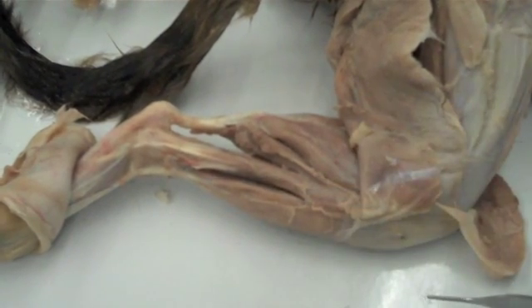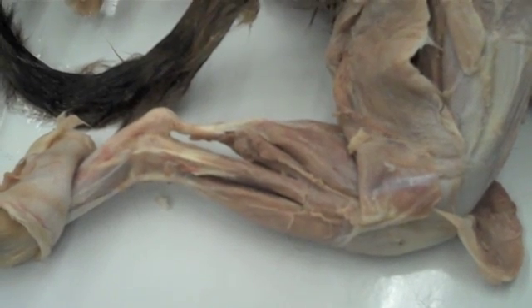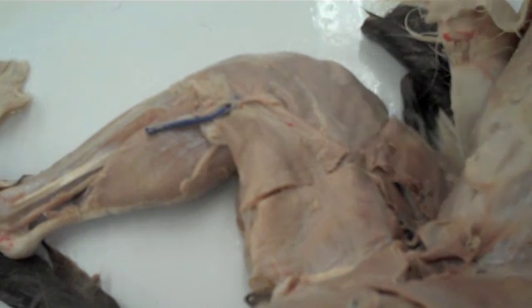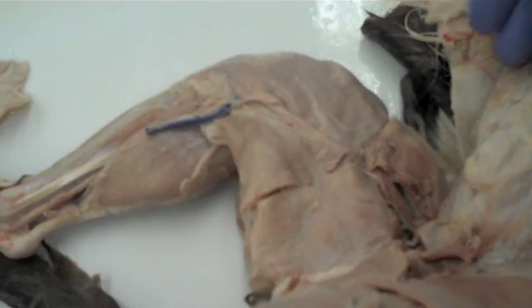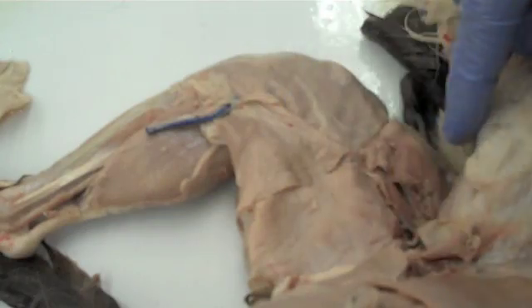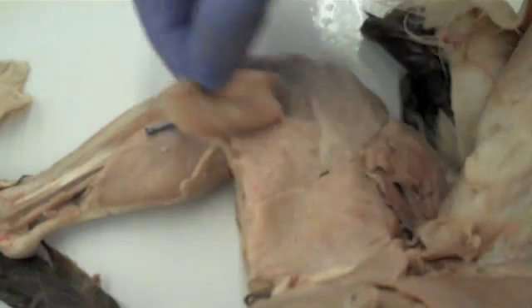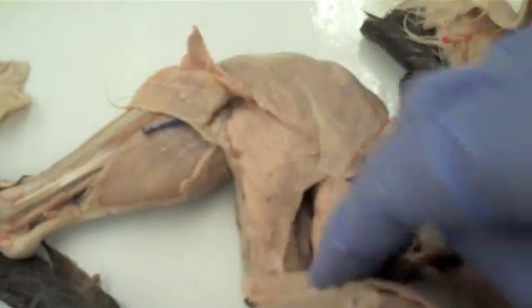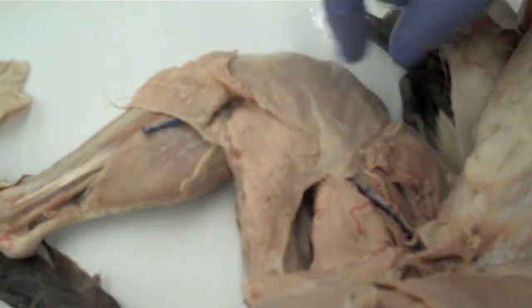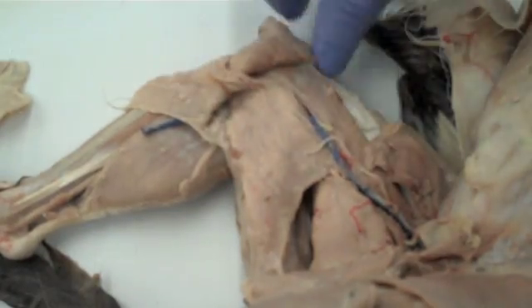In a moment I'll flip this over and you can take a look at the medial muscles of the cat thigh. On the medial right thigh, on the surface there are really only two muscles visible. One is the posterior muscle called the gracilis, which I'll reflect out of the way. The other, the anterior muscle, is the sartorius, and I'll reflect this out of the way as well. Both of these muscles were bisected during the dissection.